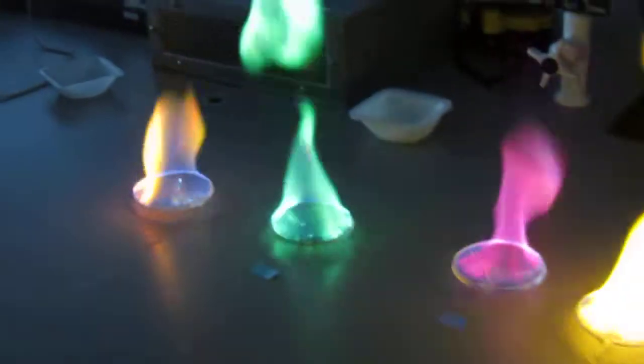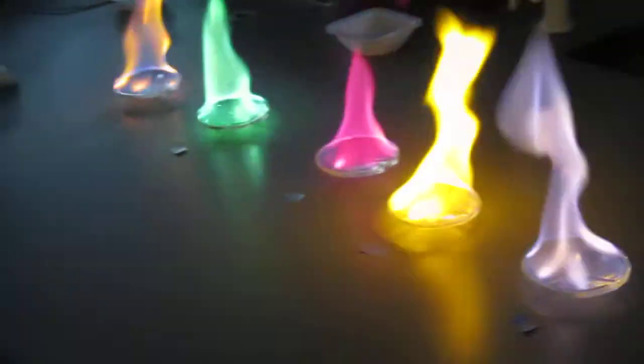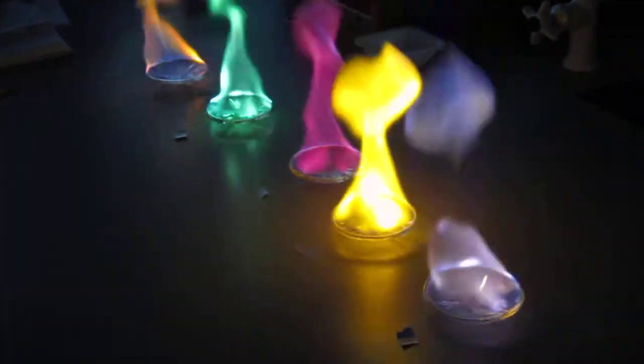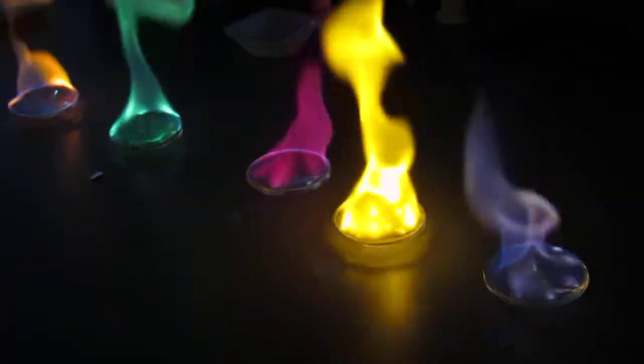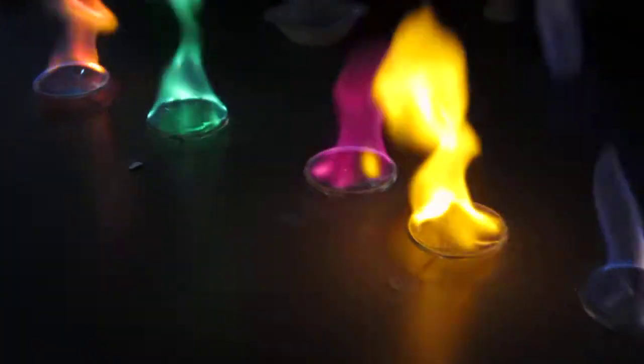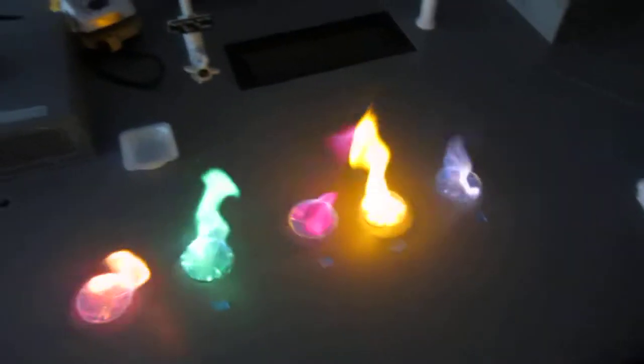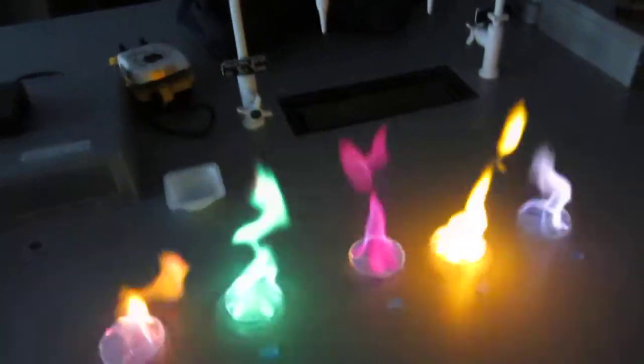Can I breathe in the fumes? You won't notice anything, it's just CO2. The reason methanol burns so blue is because it's pretty much a complete combustion, which means you're not gonna... Dude that is rad. You guys got good ones. Yeah we did, it's because we're awesome. I think it's because we dissolved it really good too. Yeah that makes a big difference.